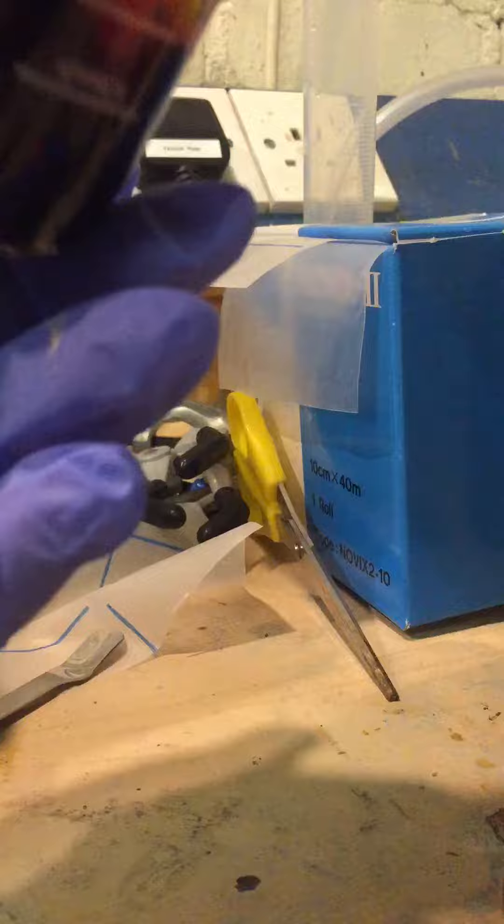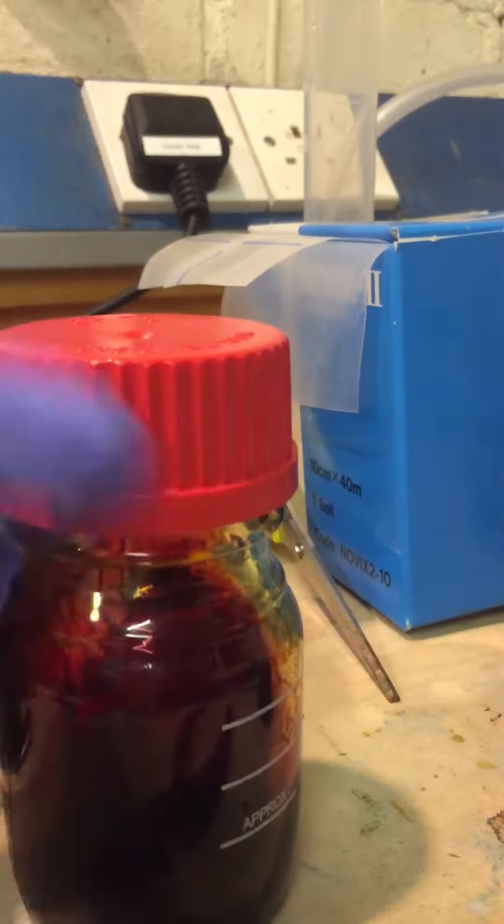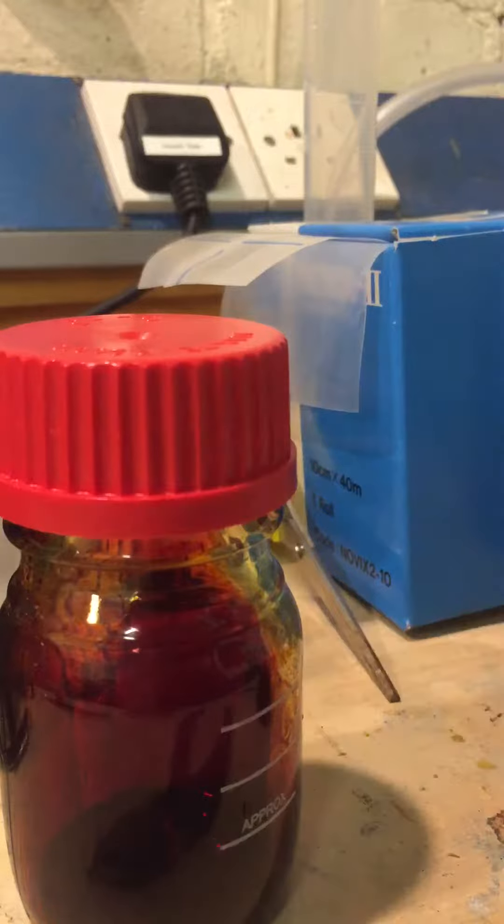Okay, it hasn't all dissolved, but it will if you give it time. I've definitely got an excess of bromine, because iodine monobromide is apparently a solid.